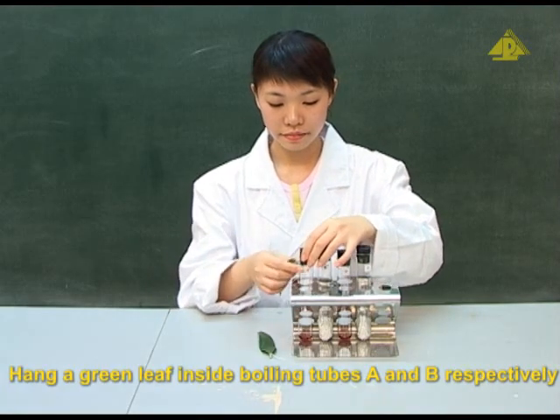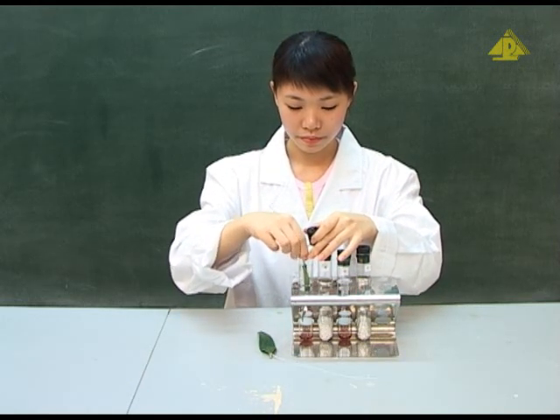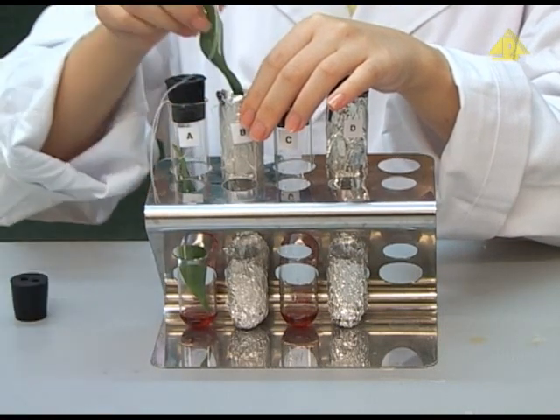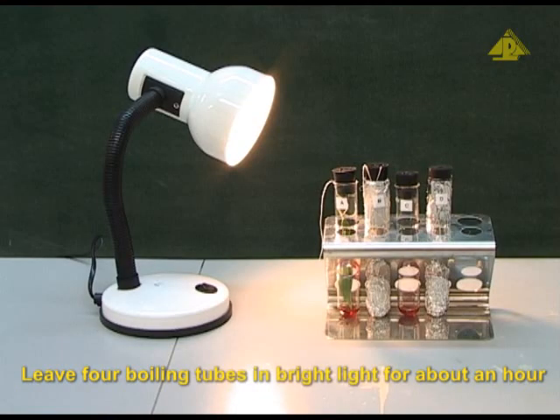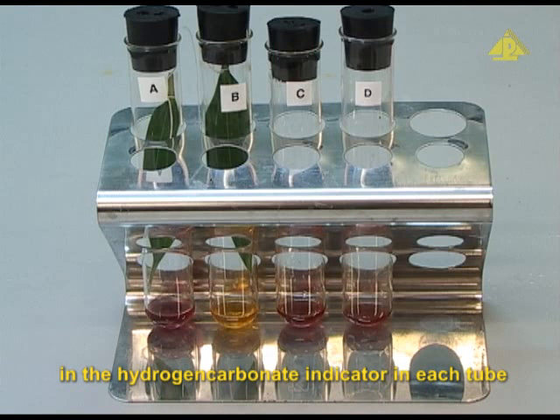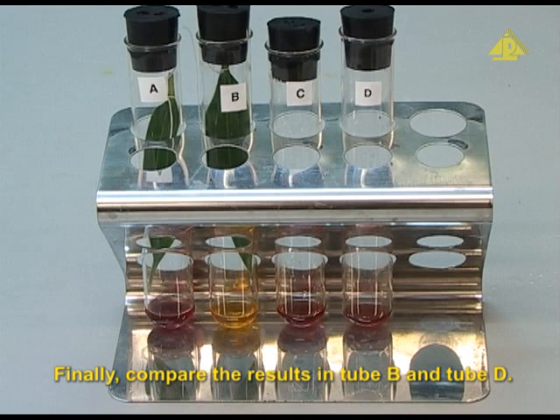Hang a green leaf inside boiling tubes A and B respectively. Leave 4 boiling tubes in bright light for about an hour. Record the colour change in the hydrogen carbonate indicator in each tube. Compare the results in tube A and tube C. Finally, compare the results in tube B and tube D.